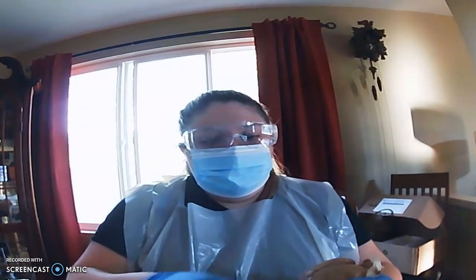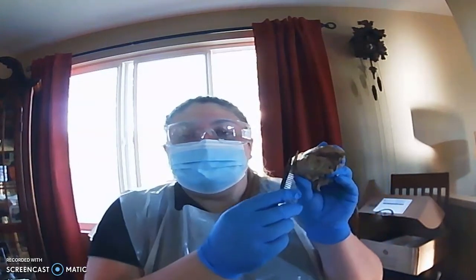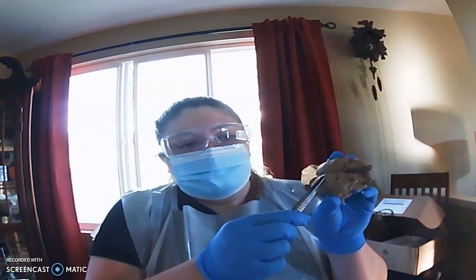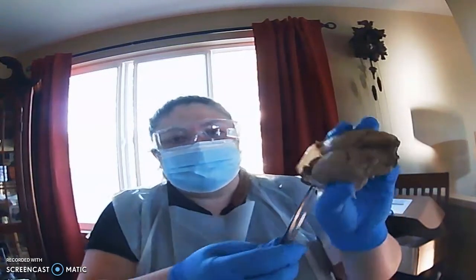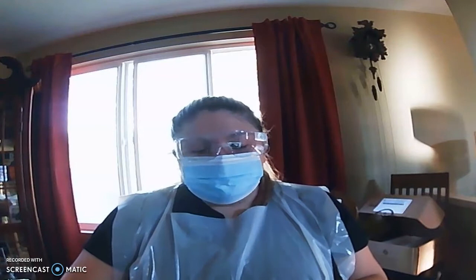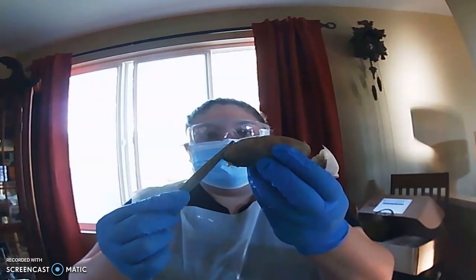And then on the outside of the brain here, this actual covering is called the cerebral cortex. The little canals on here, the wrinkle marks, those are sulci. And then the area between them that curves up, those are called gyri. People call them ridges.